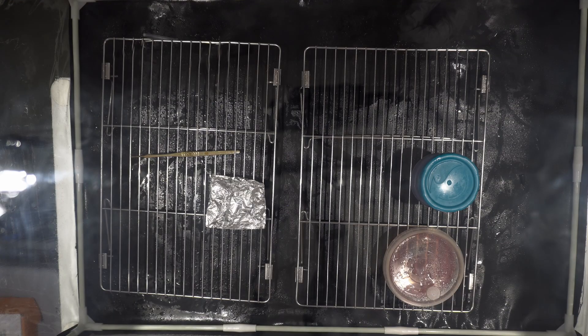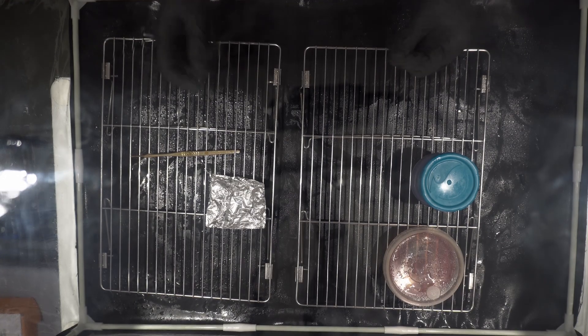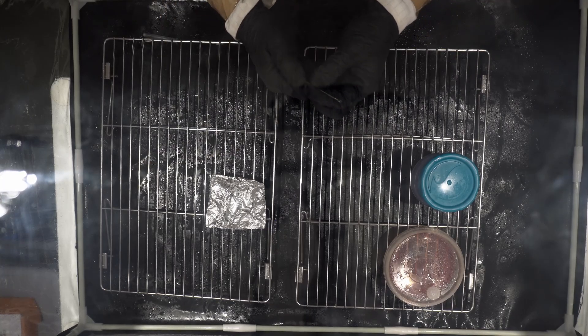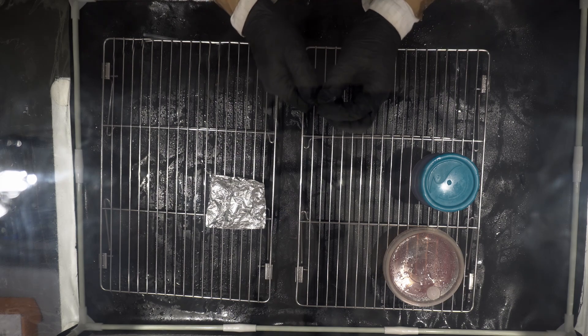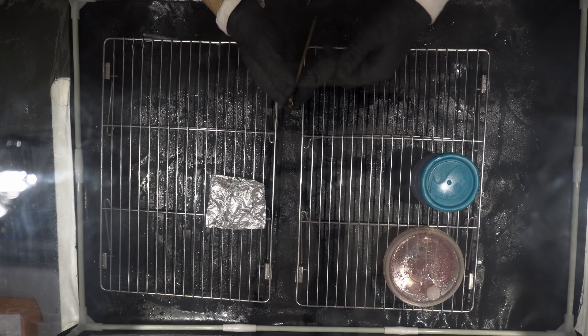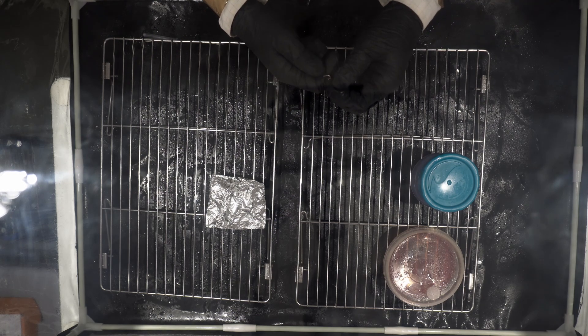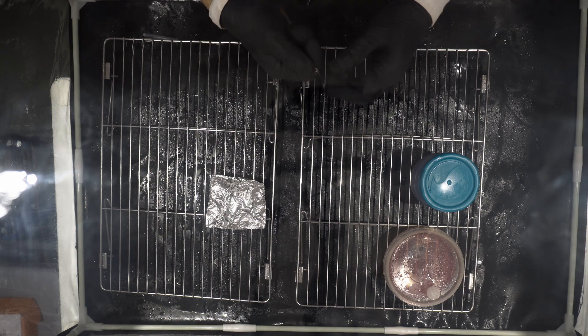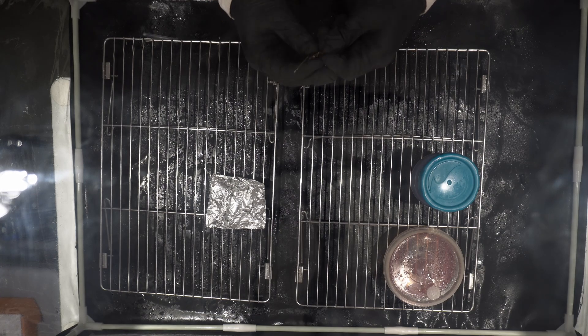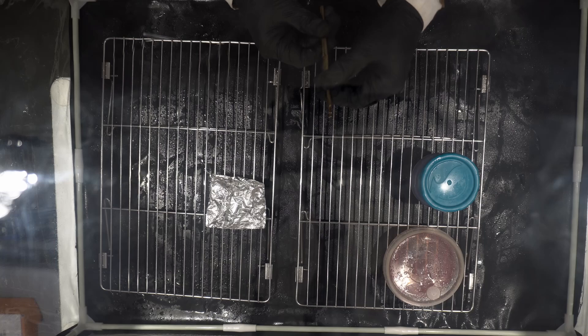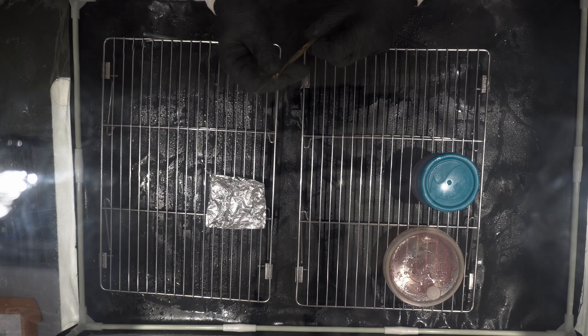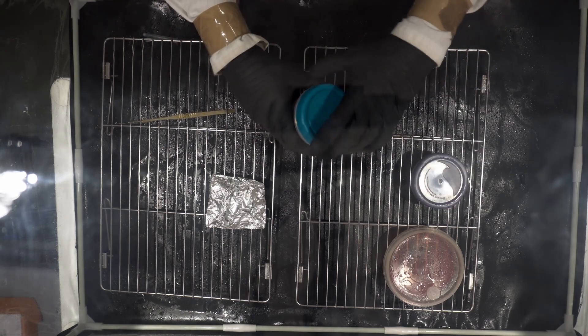Let's do it again and let's do it a bit better this time. Exactly the same situation. I've put a few pots in there so I've got a few chances to get some clean pieces of germinated mycelium. I'm going to be using a scalpel handle this time and I'm going to wrap the inoculation loop around the end of the scalpel handle. This will benefit us in two ways: first, it gives us some extra distance between the high nutrient agar and our hands, and secondly, it means that we can flame sterilize higher up the inoculation loop.